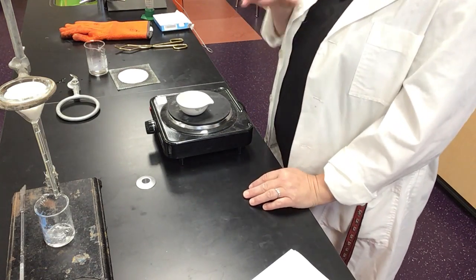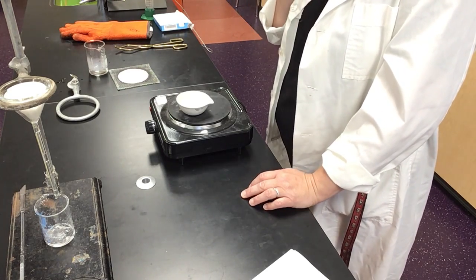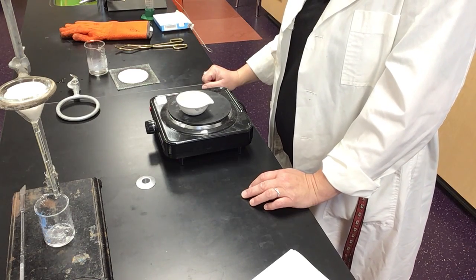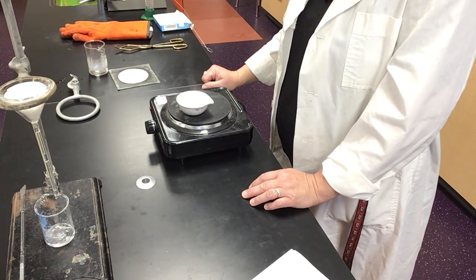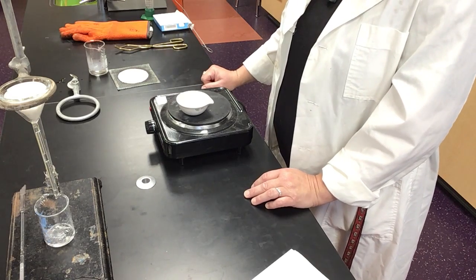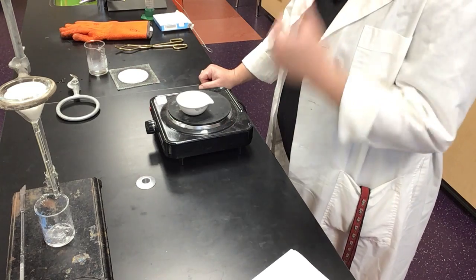We're going to do this all wrong because I want you to see what spatter looks like. So pretty soon, and it's boiling pretty vigorously. Now I'm sort of playing the part here of a lab student who isn't paying attention to my evaporating dish and cranked it up to high and then stopped paying attention. It's a terrible idea. It's boiling rapidly.